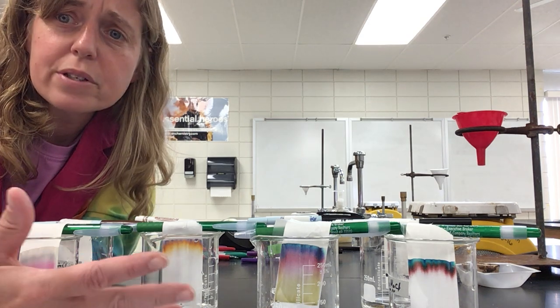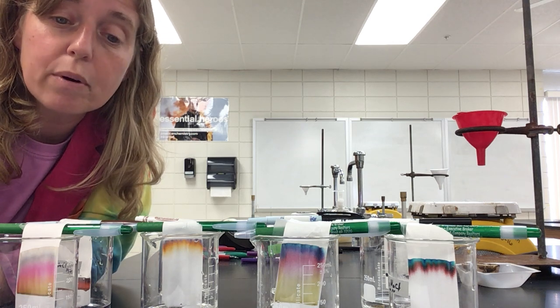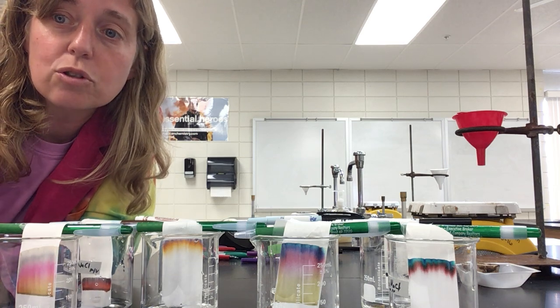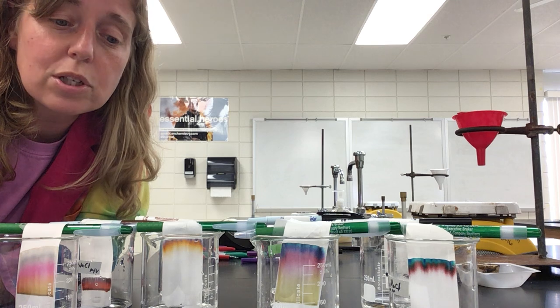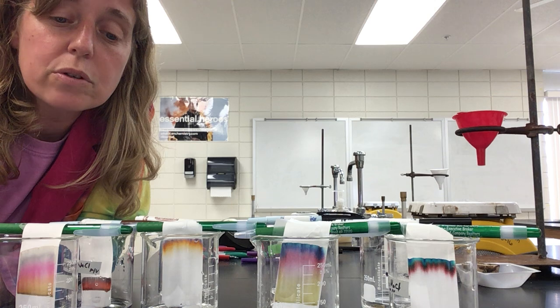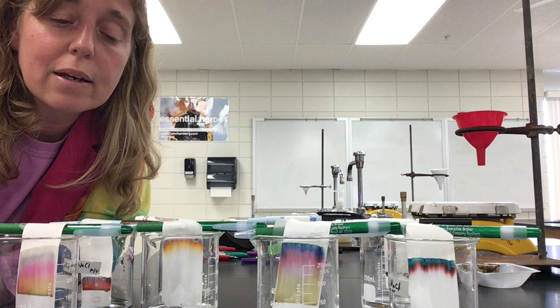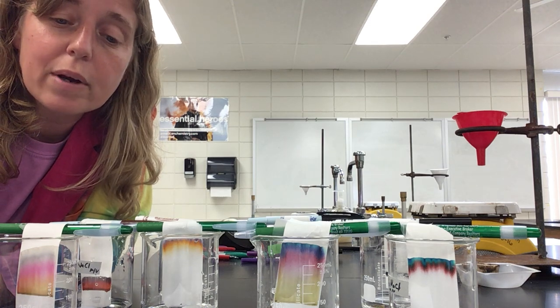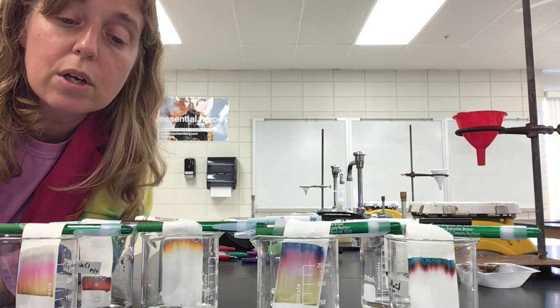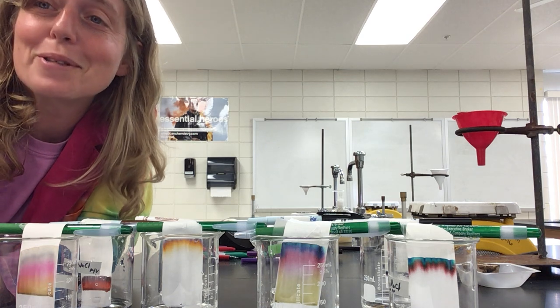So there's an example. So now in your paper, it's going to say, how did the appearance of the filter paper change during the procedure? So as you can see, if I were comparing these, you see it's going to travel. So you can answer that question there. What evidence is there that the ink is a mixture? And then how could you use this procedure to identify an unknown type of ink? And then number 4, how might the ability to separate solutions into their components be important to environmental engineers looking into water quality issues? Okay, so I'm not going to answer those for you because those are yours to deal with.